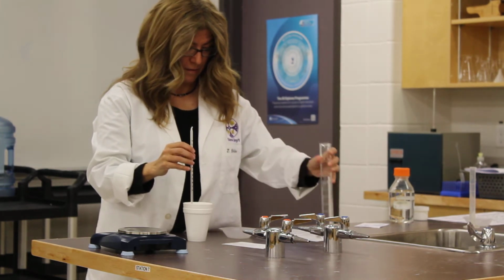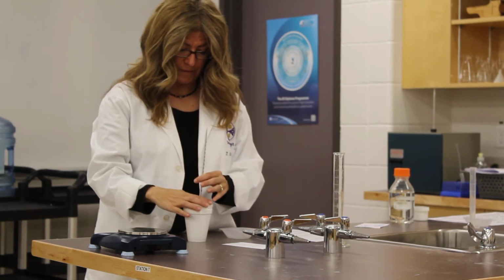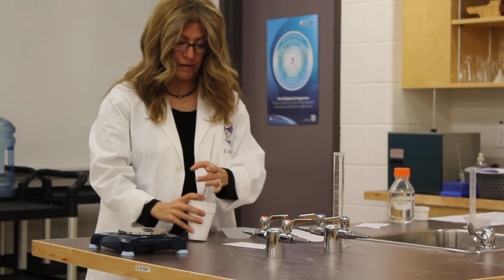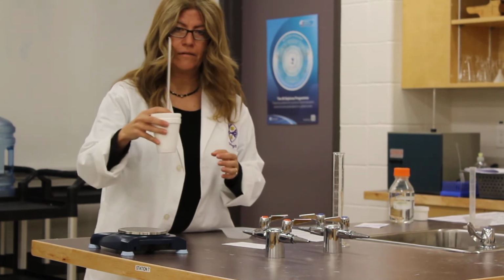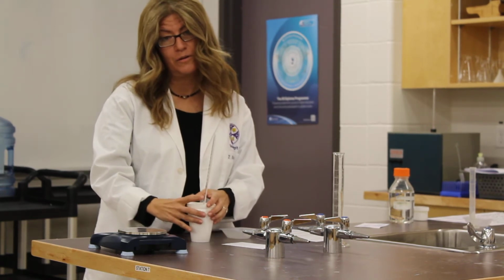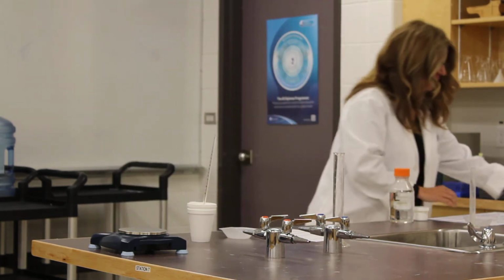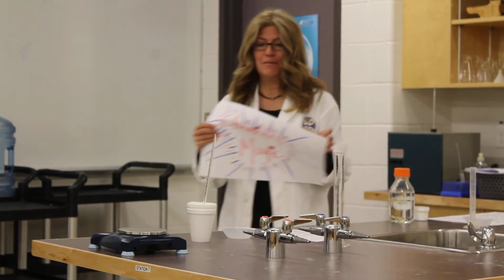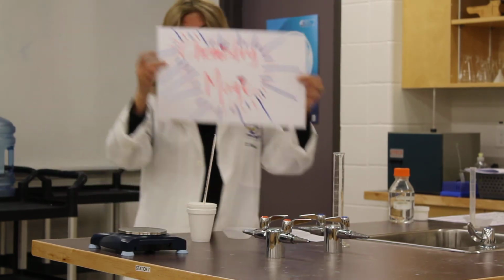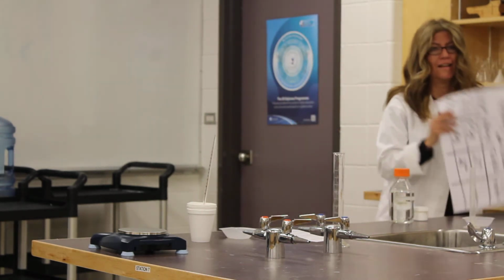What did this one start at? The other one started off at 20 degrees Celsius. I'm going to cover. I like this concept better than stirring. Oh, she's going like this. Dagmar's doing this instead of actually stirring with the thermometer. You're not supposed to stir with the thermometer, you're supposed to stir with the stir stick. Good point. So, we're going to let some chemistry magic happen. And then we're going to take the final temperature. But before we take the final temperature, this one's not moving anymore, so it's probably good, right?